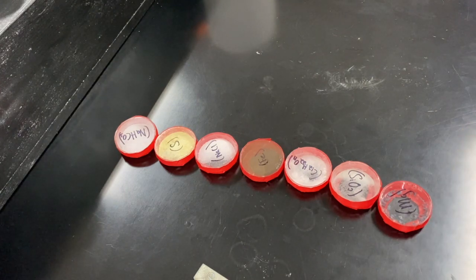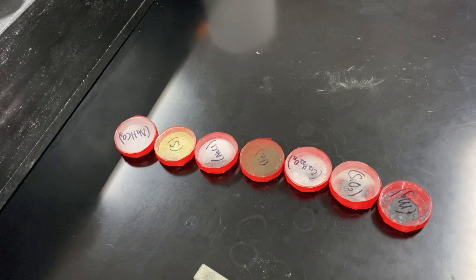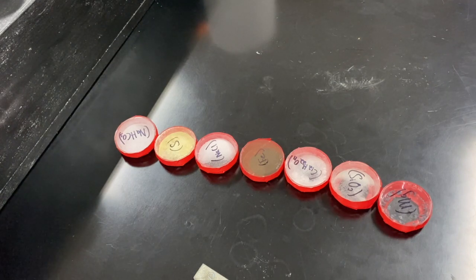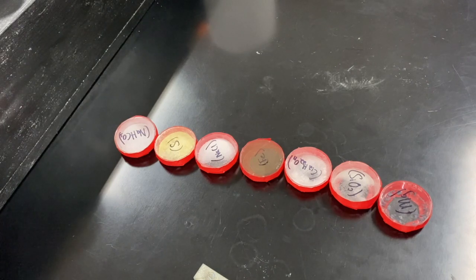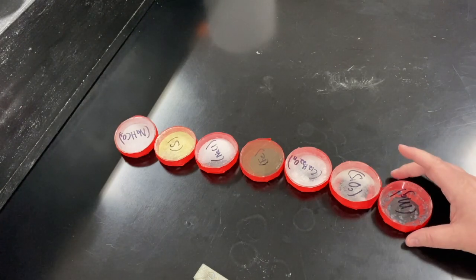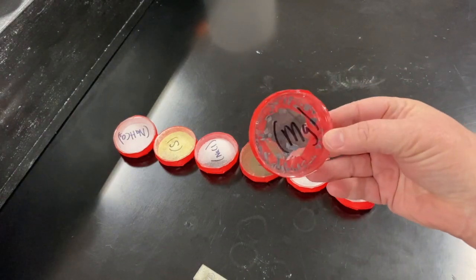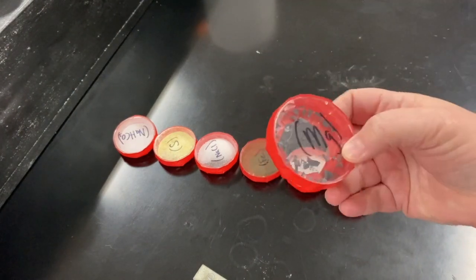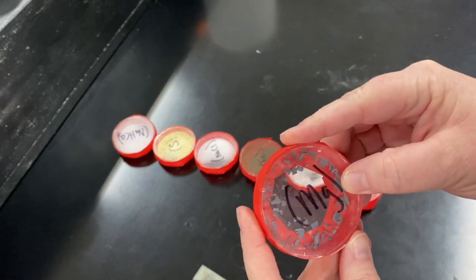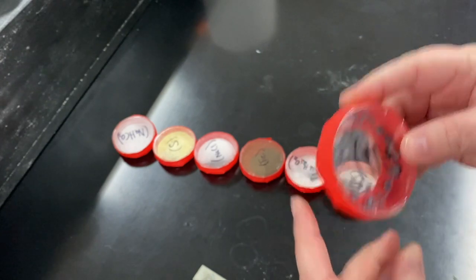You have a data table for Part A. We're going to be looking at the physical state, the color, and the odor. Obviously we can't do the odor at this moment, but we'll get to that. This first item is magnesium. Notice that it is in the solid state and it is kind of a grayish color.